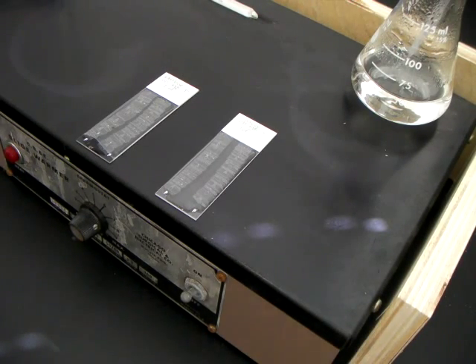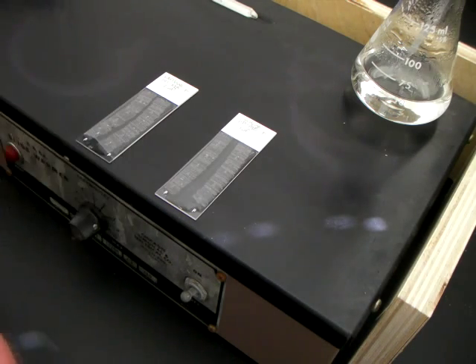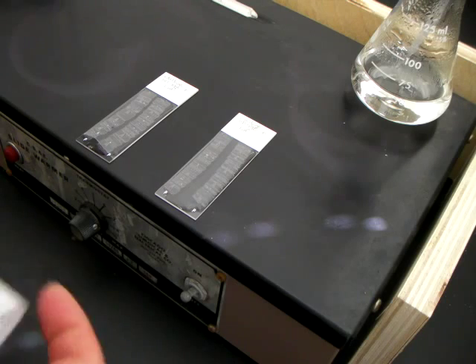Okay, so now that the specimens are sufficiently relaxed to be able to move them, I'm going to go ahead and wick some of the water off here.